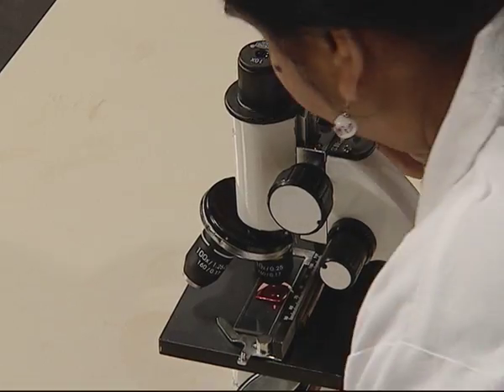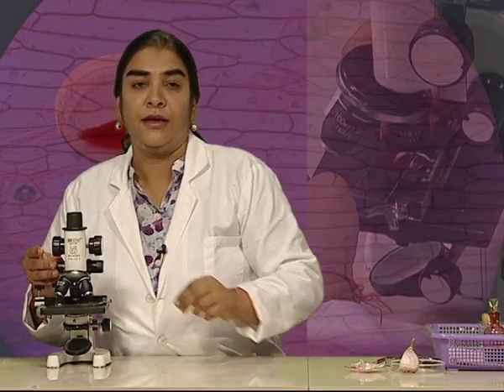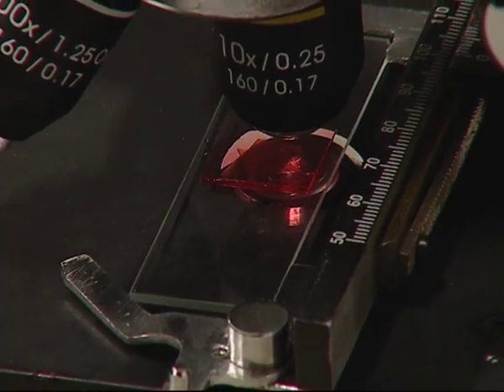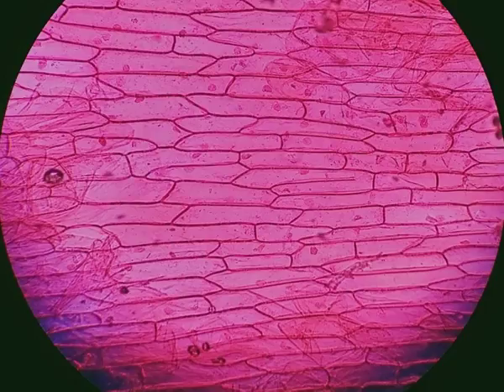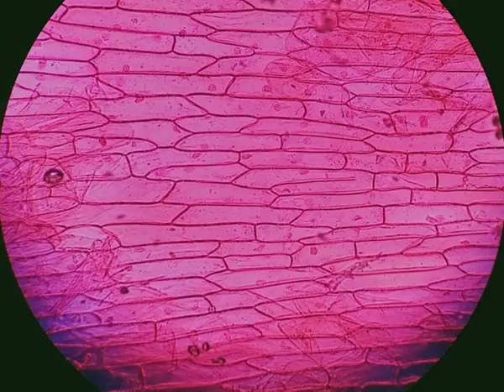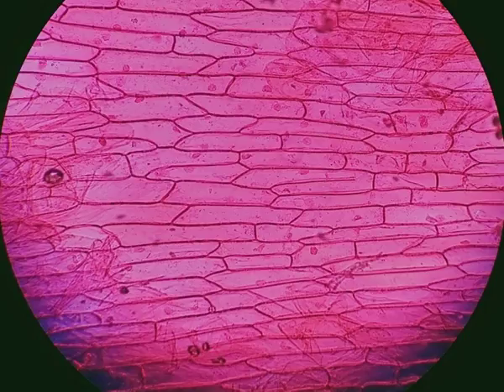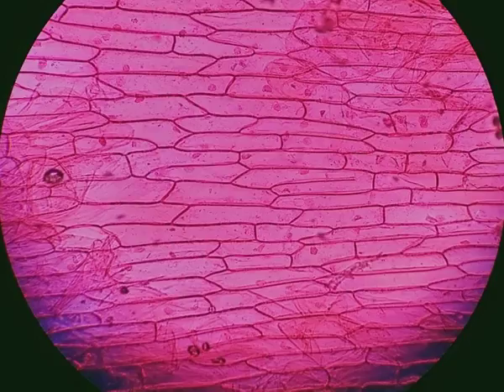Now we place the slide under the microscope and observe it. When you see the temporary mount under the microscope, you will notice that the safranin stain has colored the outer tough cell wall, which is clearly visible. There is a nucleus present in the plant cell — it is not in the center but towards the side. The cytoplasm fills up the entire space of the cell.